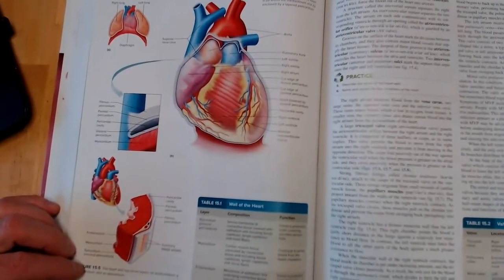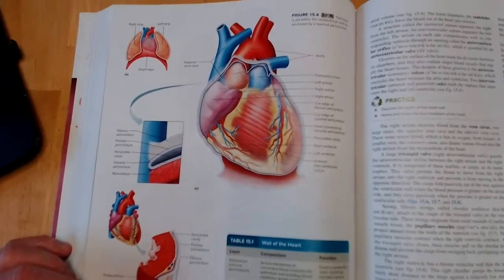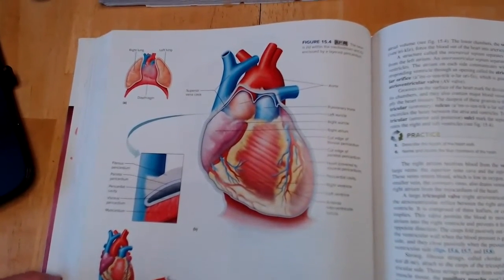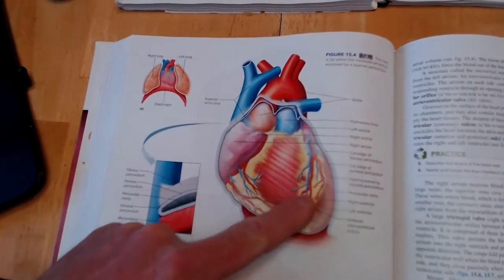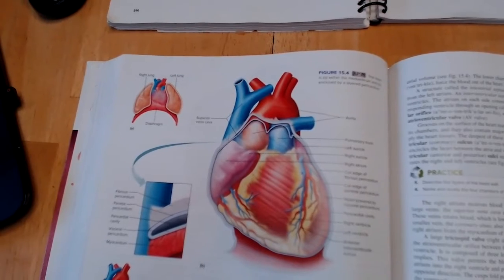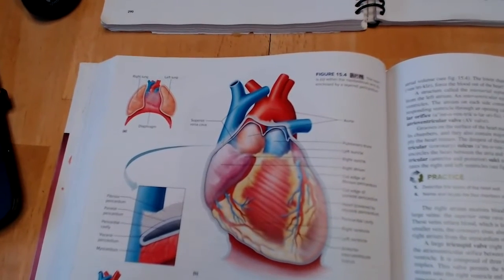In a few minutes, we're going to pull the deer heart out and show you some structures. But one thing that I do want to talk a little bit about, so you're aware of what you're looking at, is the fibrous pericardium, which is this sac that surrounds not only the deer heart, but your heart as well. And you're going to see some fat on the surface of this fibrous pericardium.